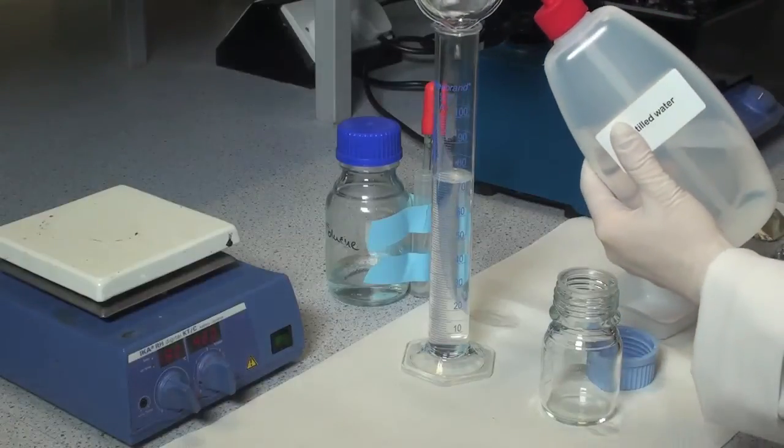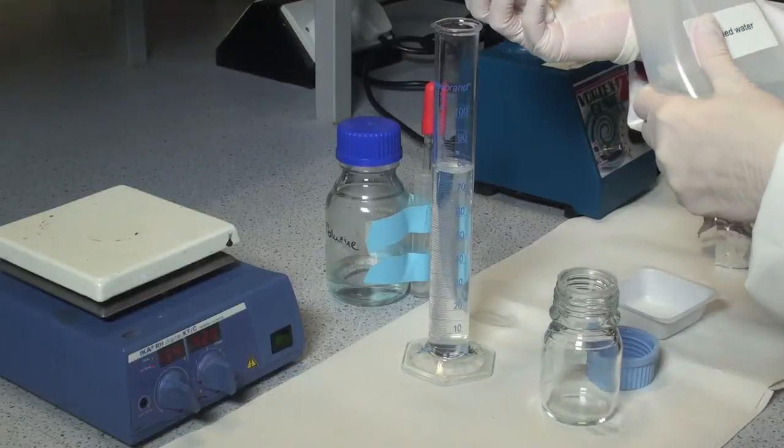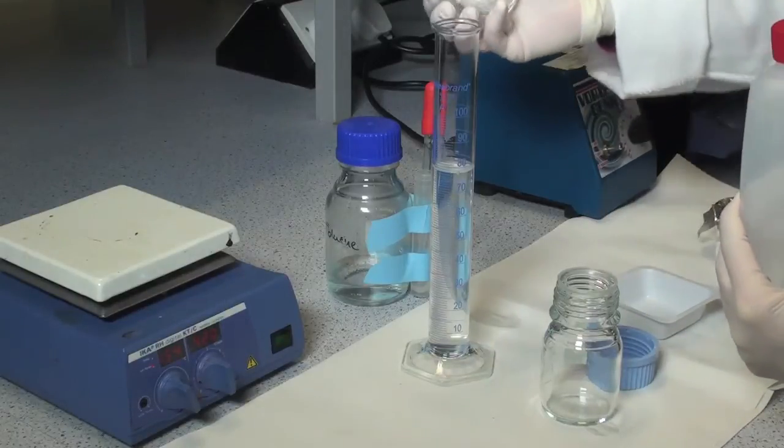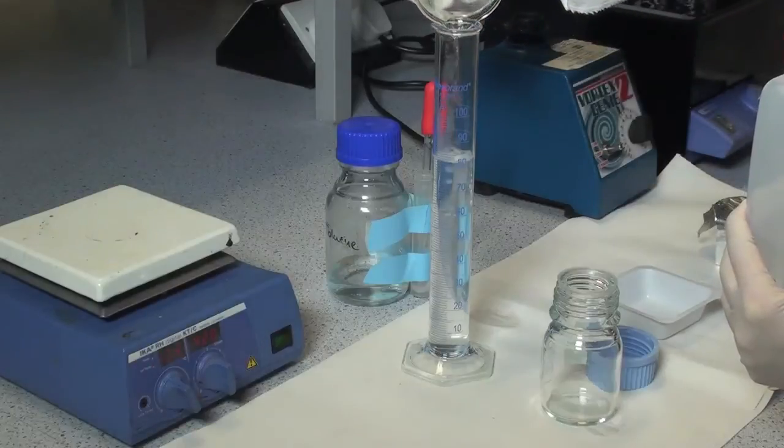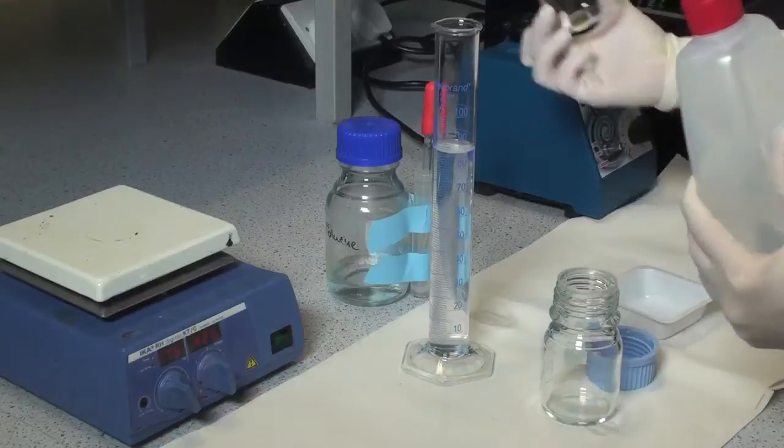Rinse the beaker with distilled water and make up the volume to 100 ml with distilled water.